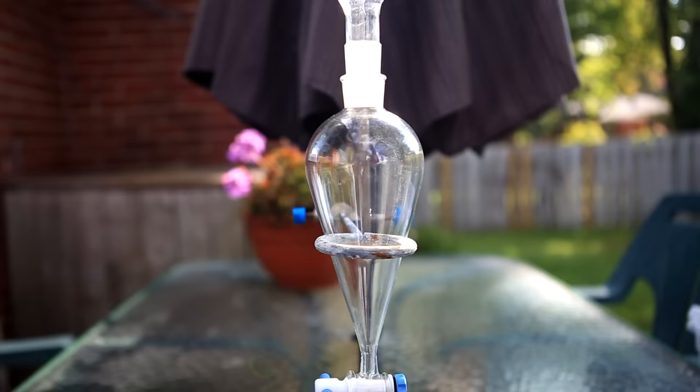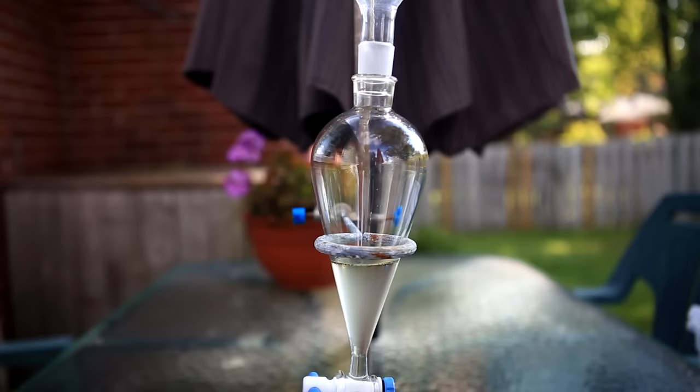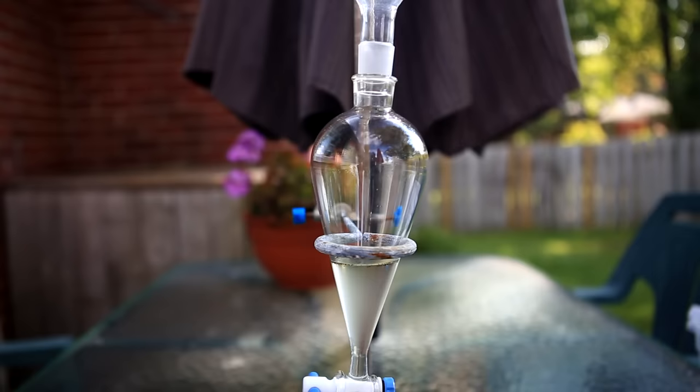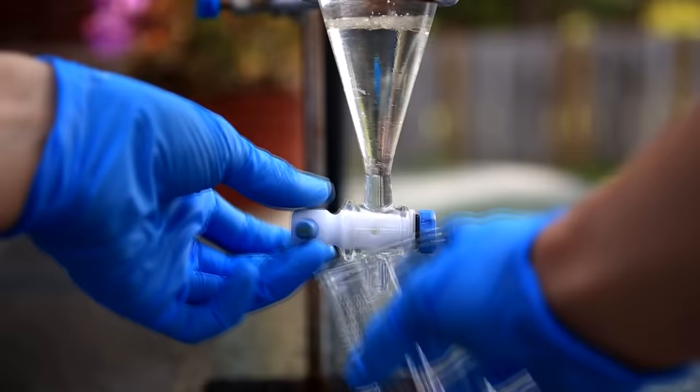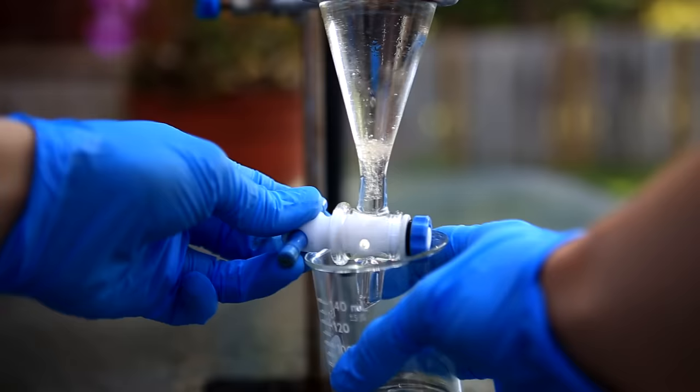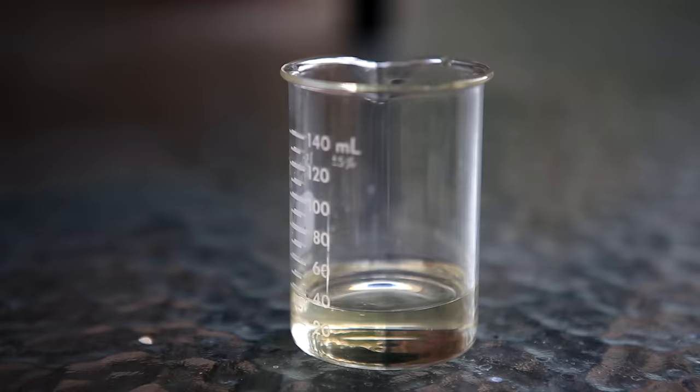All of the organic solvent extracts are then poured back into a clean separatory funnel. You might notice that it looks a little bit cloudy. To fix this, we pour in some saturated salt solution. The salt solution is used to pull water from the organic solvent. I don't show the capping and shaking, but you'll notice that the bottom dichloromethane layer is now much clearer than it was before.